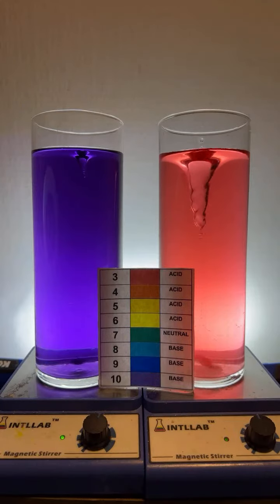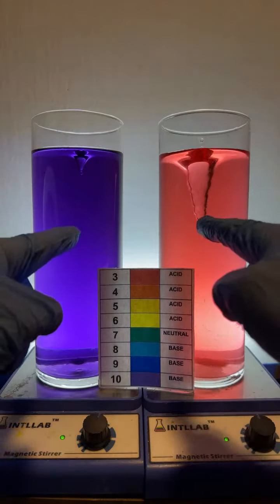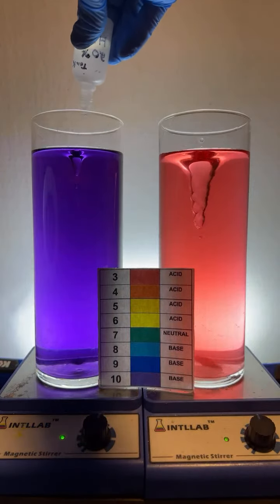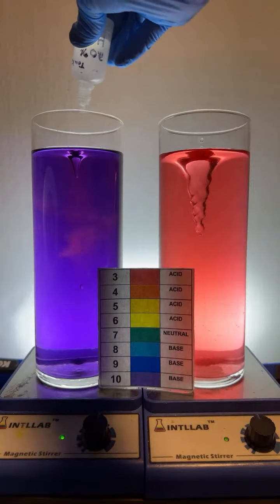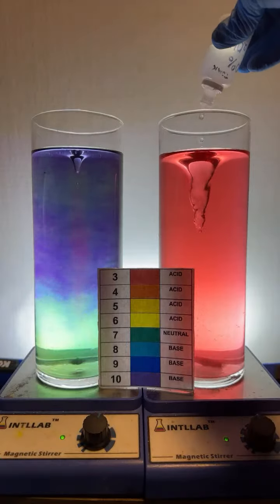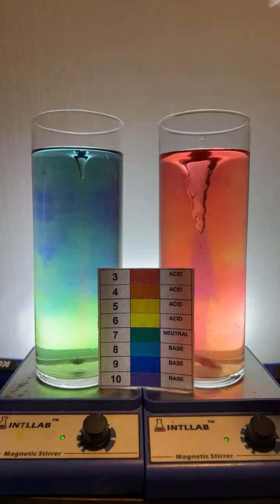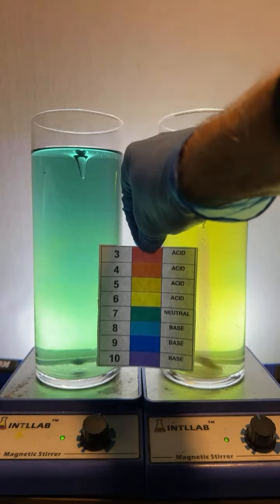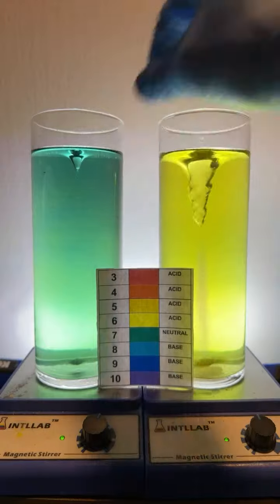What is the liquid in the glass, and what are the drops I am adding? The temperature of the acid is just room temperature. So, the liquid in the glass is water, and to the water, I have added some universal indicator. Universal indicator is a mixture of 4 different dyes, and those dyes change color depending upon pH, which is how acidic or basic something is. And together, they create these colors at different pH values. So you can keep your eye on this as I'm doing the experiments.